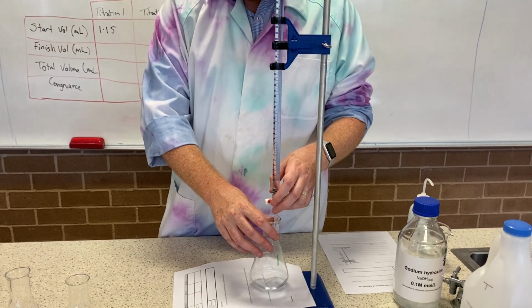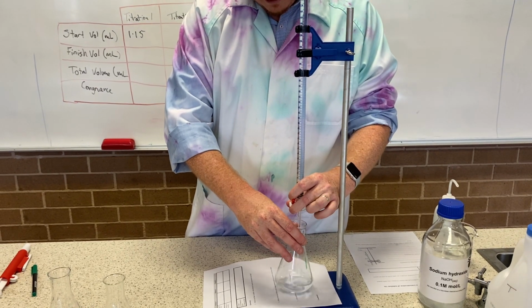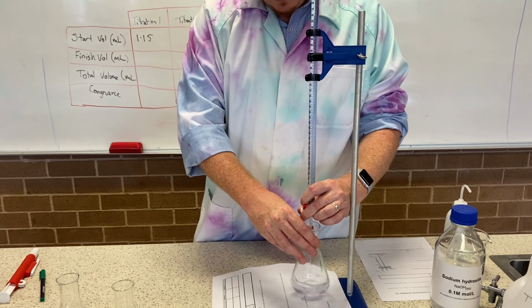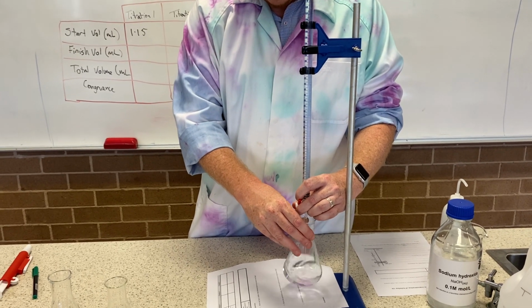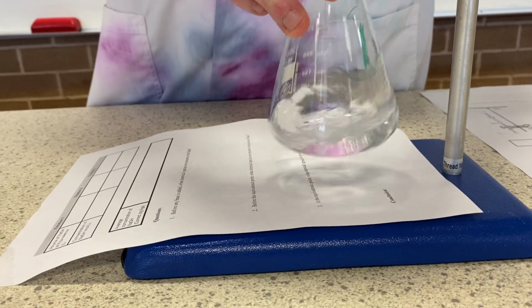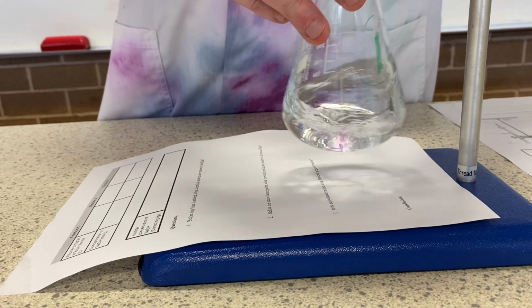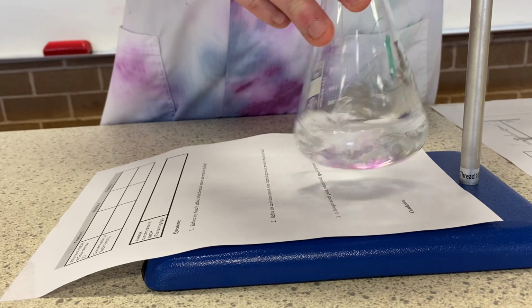So I've already got kind of a preview of what's happening. All right, get a nice steady stream. After a bit of time, you might notice a little bit of pink going in there. And what you're looking for is that pink and how long it sticks around. Notice it doesn't stick around long if I give it a stir. Once I'm getting towards the end point, it'll start sticking around a bit longer and getting harder and harder to stir out.